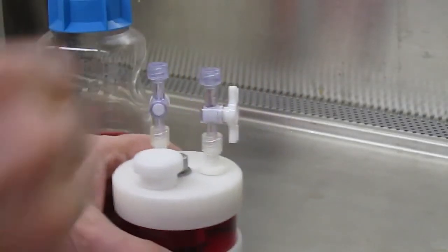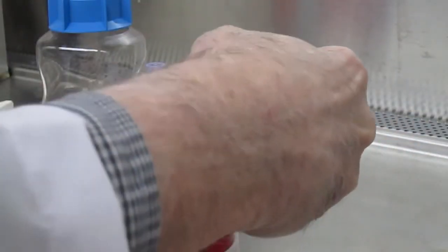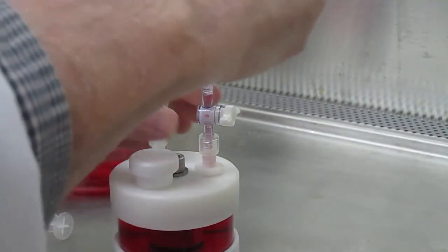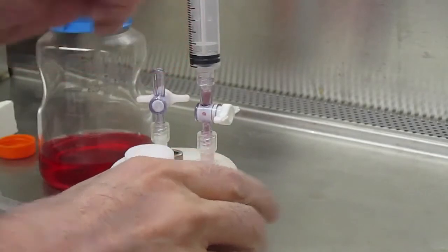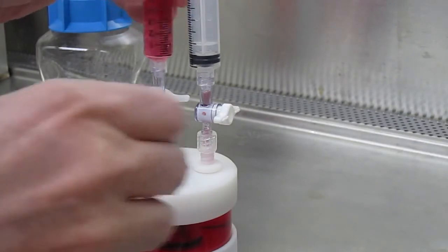An empty syringe is placed on one of the fill ports, and a syringe filled with media is placed on the other port.